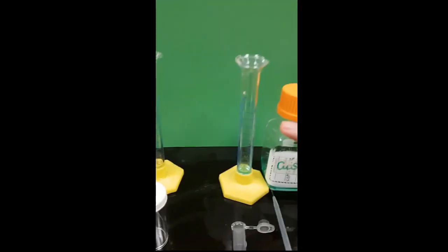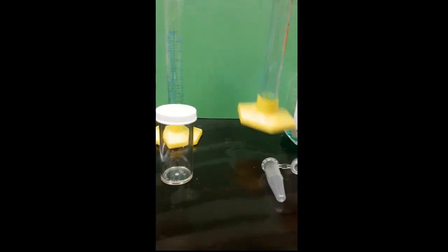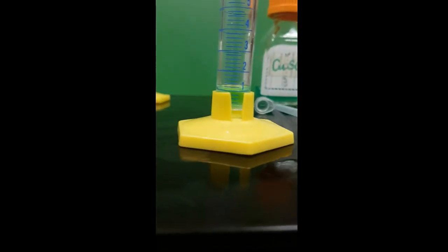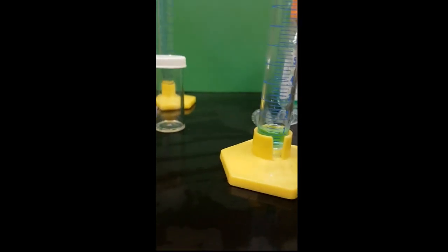Please make sure that you lower your body at eye level in order to read the volume of the graduated cylinder to make sure that it is correct.